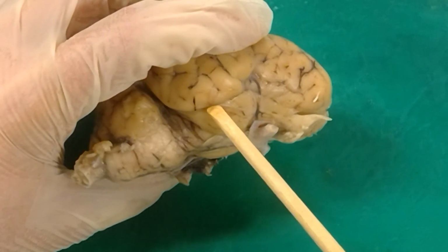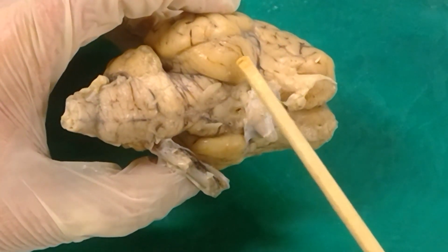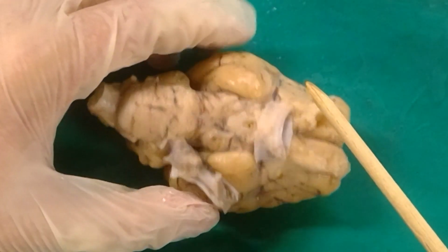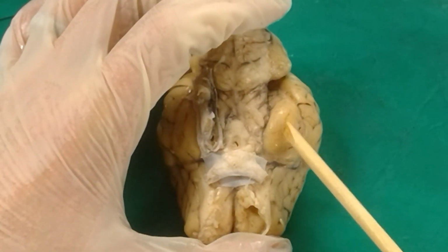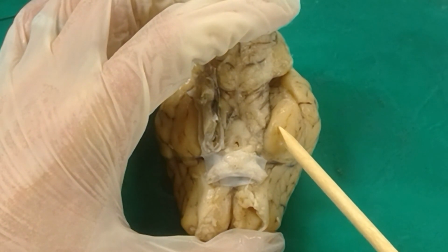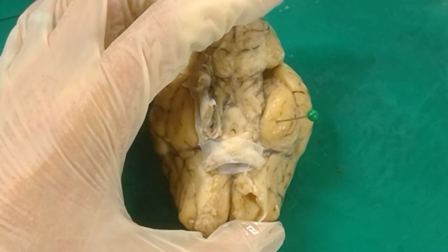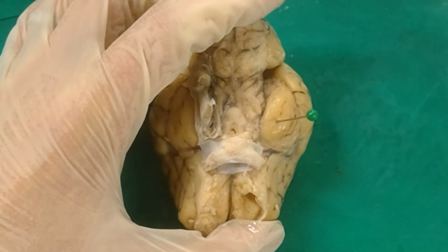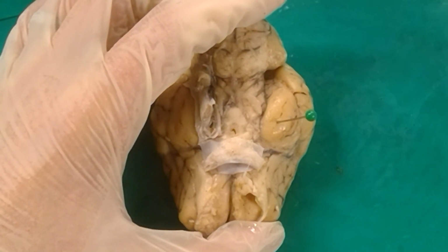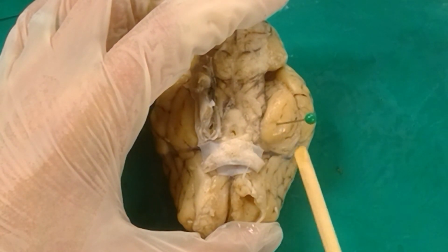The rhinal fissure, going back to this, is separating neocortex, which is newer cortex, from this evolutionarily older cortex known as allocortex. This gyrus right here that's part of the allocortex is known as the hippocampal gyrus. It's called the hippocampal gyrus because the hippocampus is sitting right underneath it. Makes sense, right? At the very topmost point of this hippocampal gyrus, where it bumps out the most, if we were to stick a pin right through there and say, number one, name this gyrus, and number two, name the nucleus that sits just underneath this cortex, the gyrus would be the hippocampal gyrus, and the nucleus that sits at the very end of the hippocampus is the amygdala, one of those major emotional processing areas of the brain.